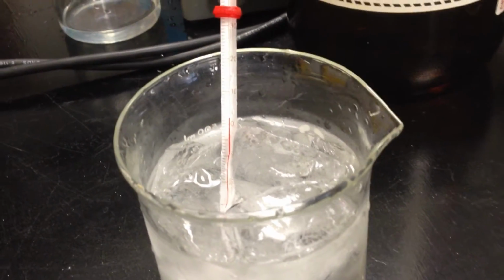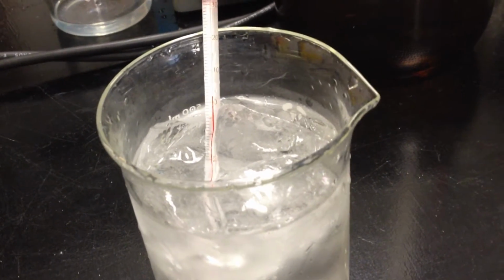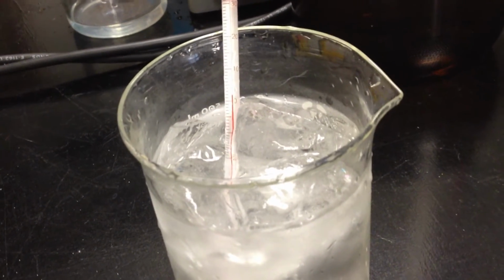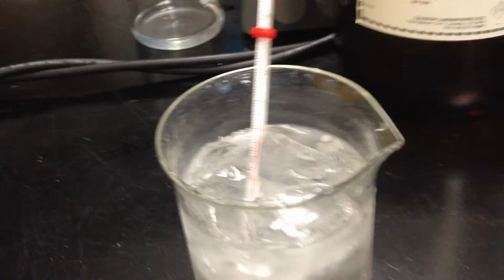Normally, when you dissolve a salt in water, the energy that is needed to break the bonds of the salt comes from the heat that's in the water. So what we should observe if we add some salt to this ice water bath is that the temperature will suddenly drop as the salt dissolves. And I'll do that. I'll hand over the phone so somebody can film it.